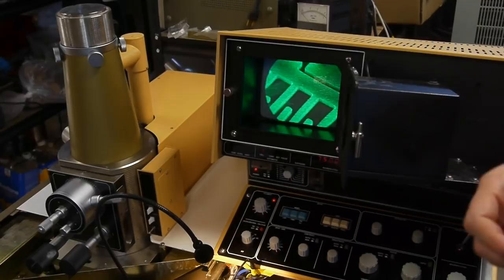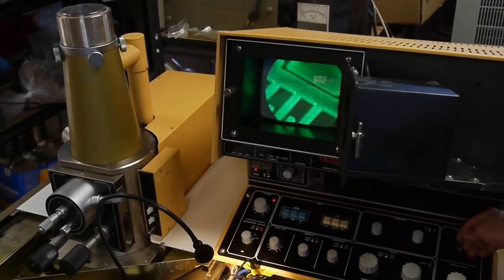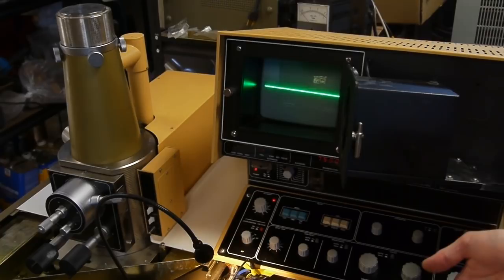So when we're zoomed in like this, we're in video mode now, which is kind of like a low resolution fast scan rate. And this is so that we can move around and get the image set up and focus it. And then to actually take an image, we slow down the scan rate to something very low. In fact, it's too low to even see the image. It's just a line that's tracing down.